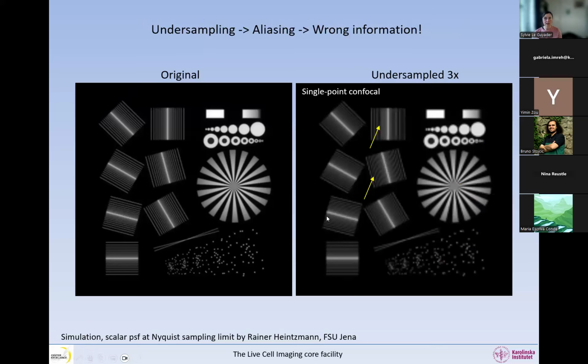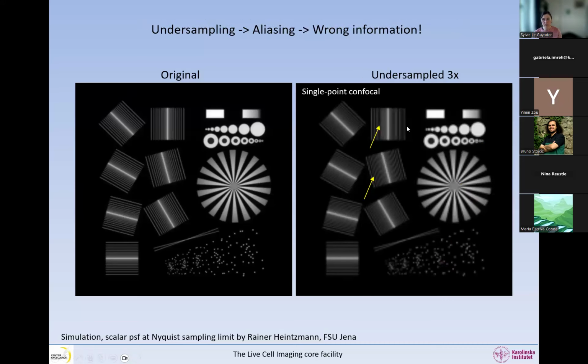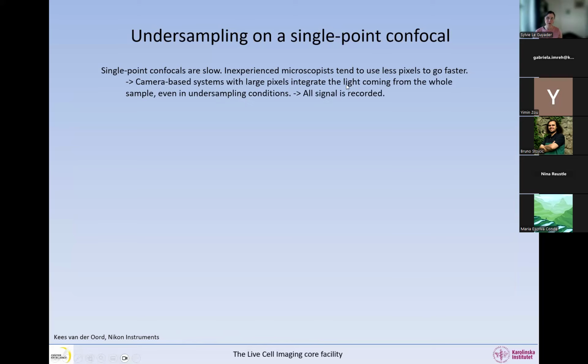When we look at a single-point confocal, so this would be like the modeling for a camera-based system, it's exactly the same, except that the patterns are slightly different. But otherwise, all the artifacts are still there. So when we undersample, we create aliasing artifacts of this sort, and the information in the image is wrong. Single point confocals are very slow, and inexperienced microscopists tend to use fewer pixels to go faster. And this is not a good strategy.